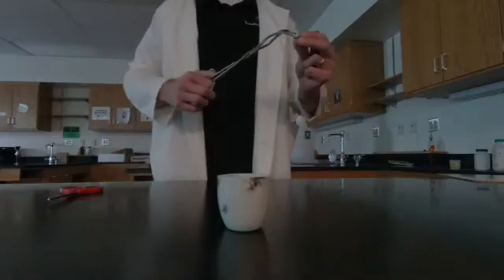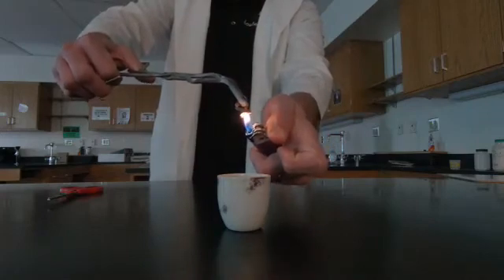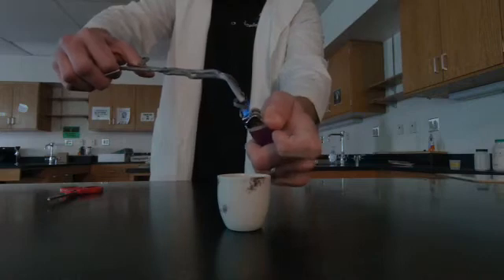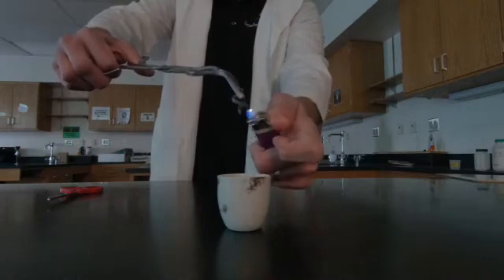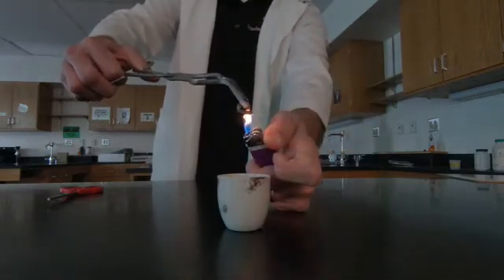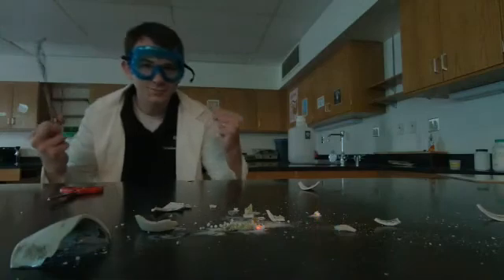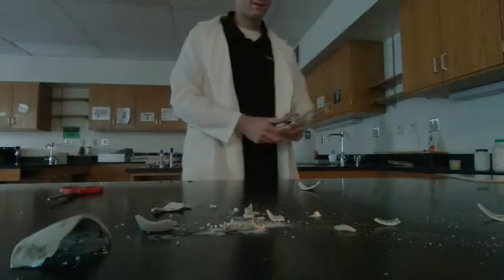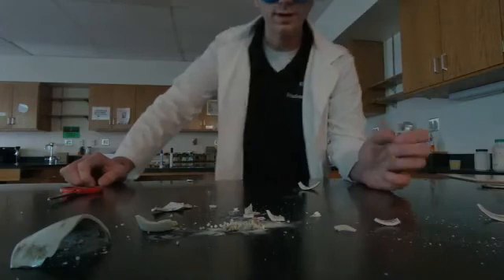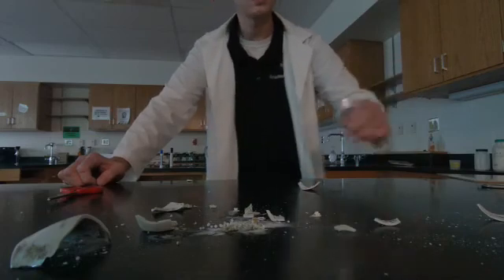So what we got here — run through the same process. Wonderful. The need for an oxidizer, for particular reactions like the firework chemicals we're studying. Definitely a noticeable difference there, guys.